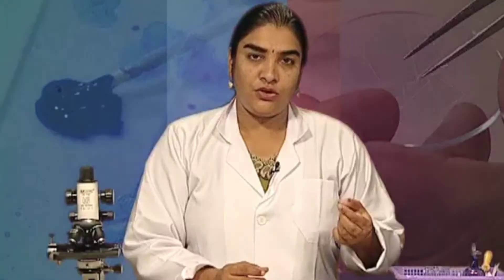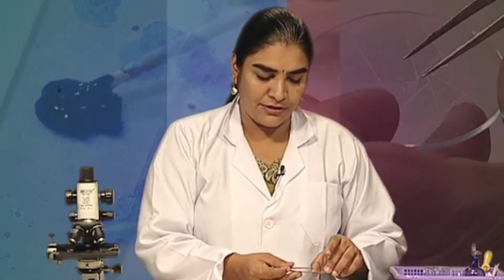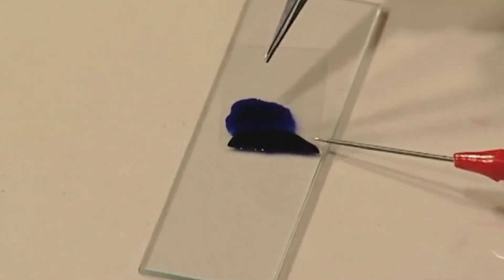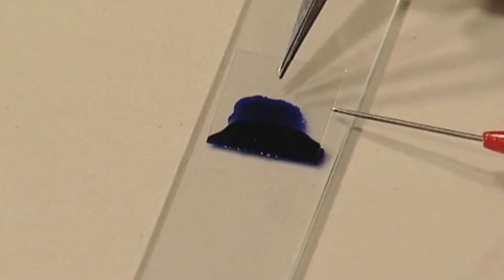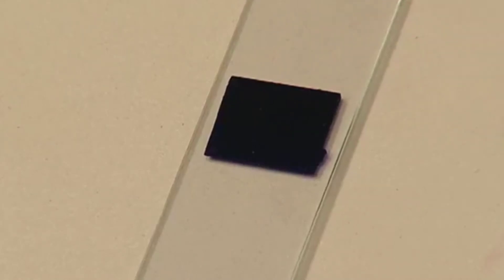Please throw the used toothpick in the dustbin — it cannot be used again. Now, with the help of a forcep and needle, gently place a coverslip onto the material that has been mounted on the slide. Place it very slowly so that there are no air bubbles in the slide.